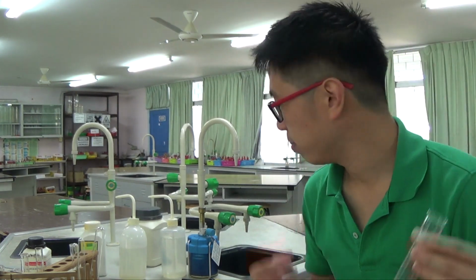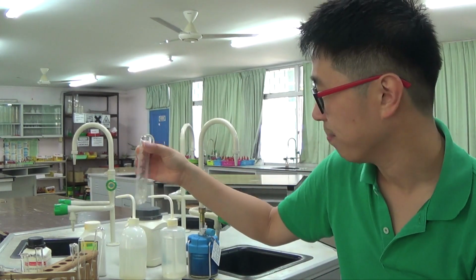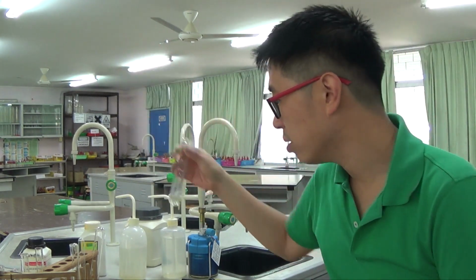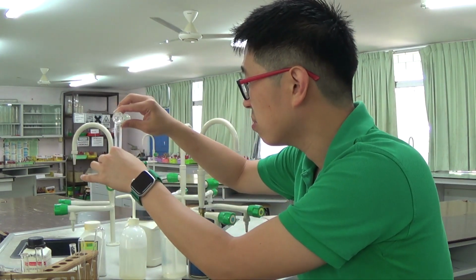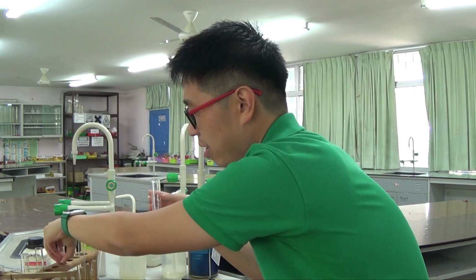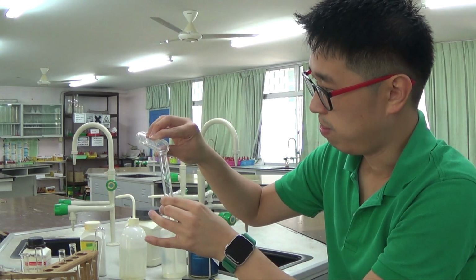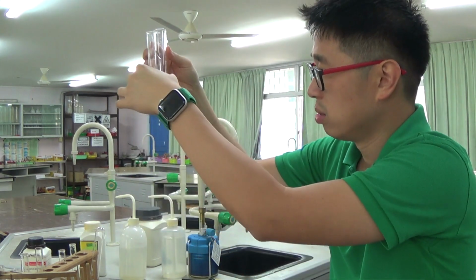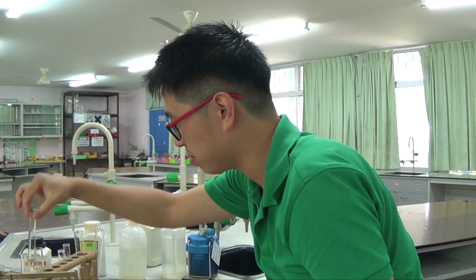That's why we always make up our iron(II) sulfate in acid, because it will slow down the reaction. Anyway, so two cations. I will split it into two portions. No, actually I'll split it into multiple portions because I also need to test for the anions as well. So a couple of portions is alright. So three portions.